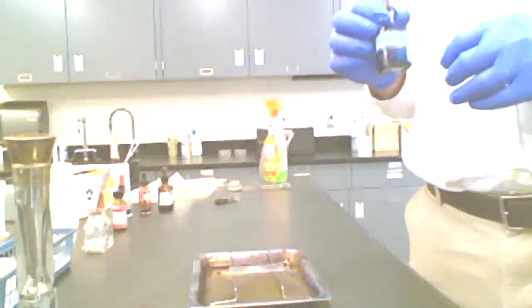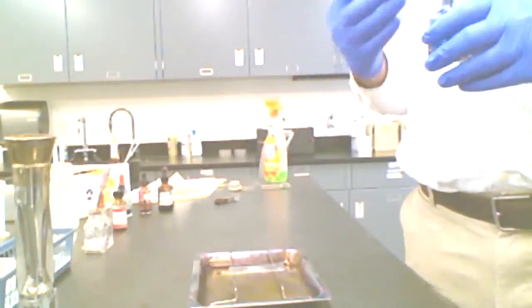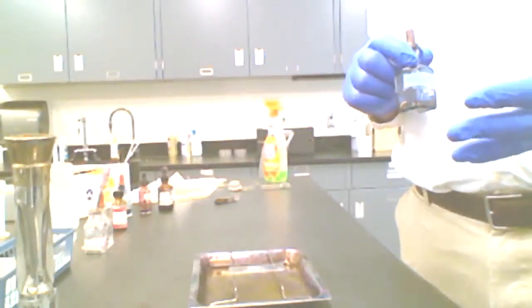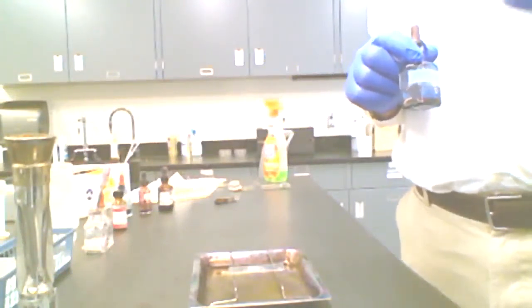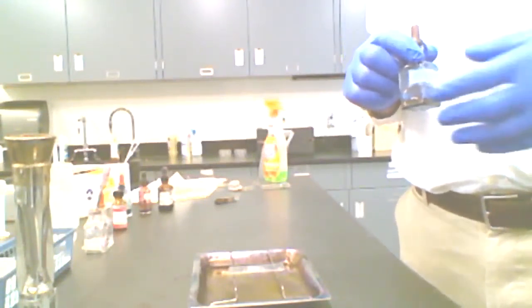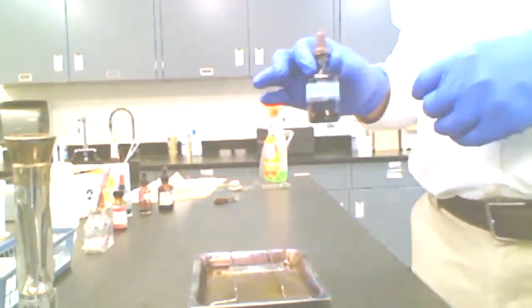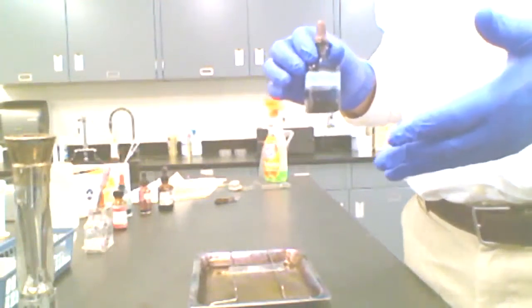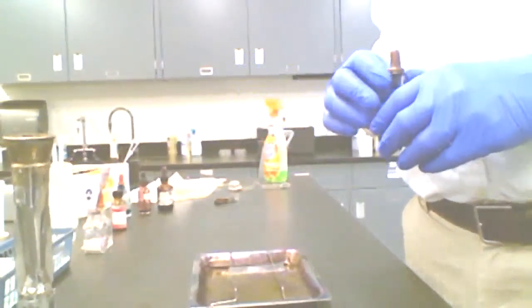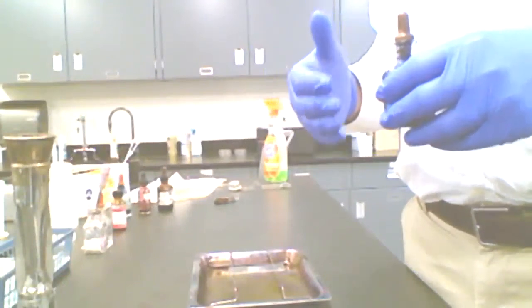Now what I'm going to do is apply my stain. Now this is a simple stain. A simple stain is any stain where we apply a single stain reagent. There are stains later that will require 2 stains, a primary stain and a counter stain. Those are called differential staining techniques. But here I'm wanting to use just a single stain. And all I'm doing is trying to highlight the organisms so that I can see them. That's my only concern. I'm not going to learn anything about chemical characteristics of the cell walls or anything like that.